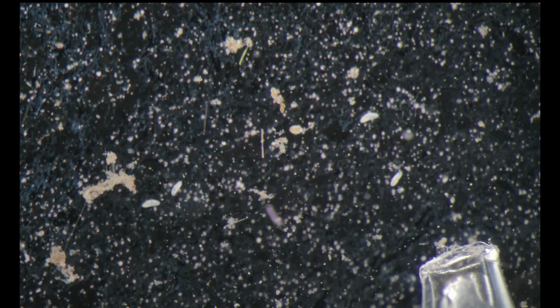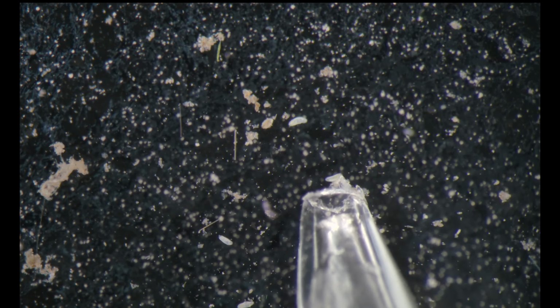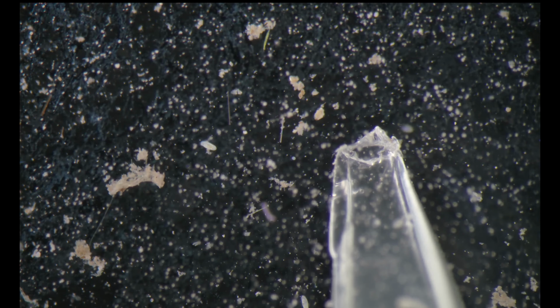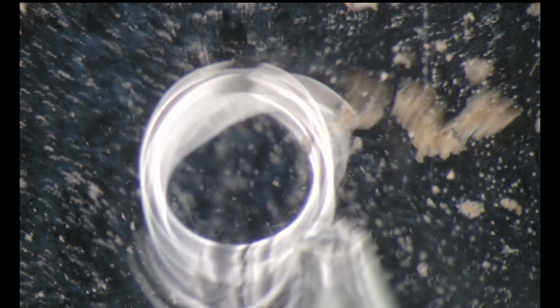We can just be very delicate and use as much as we need. See? With the same one I took two. One, two, no. Let's free it.